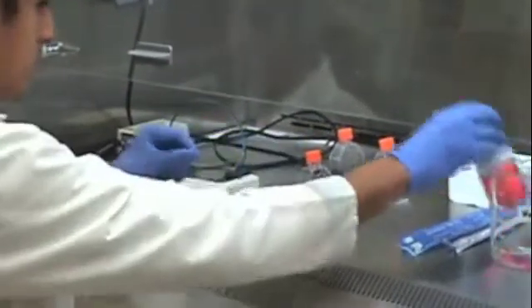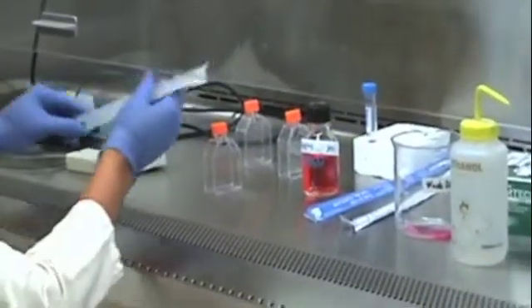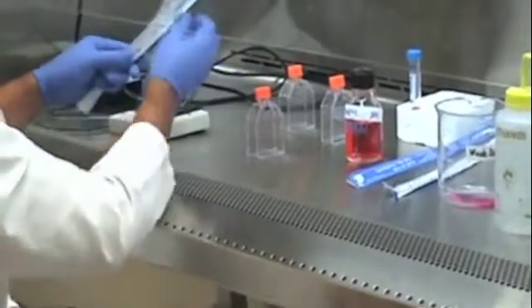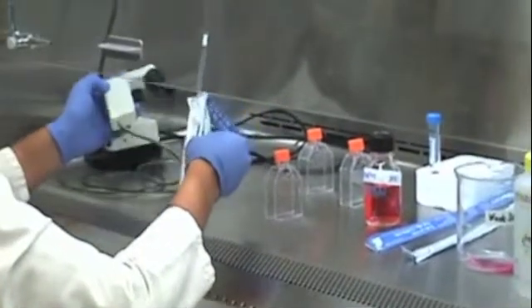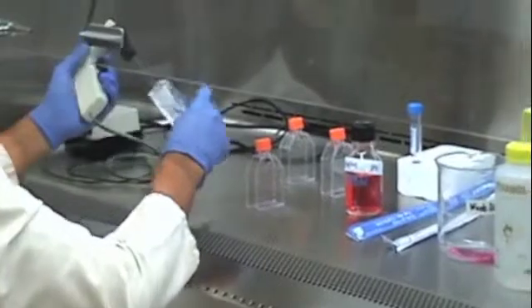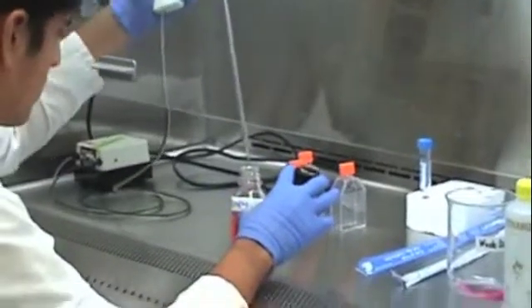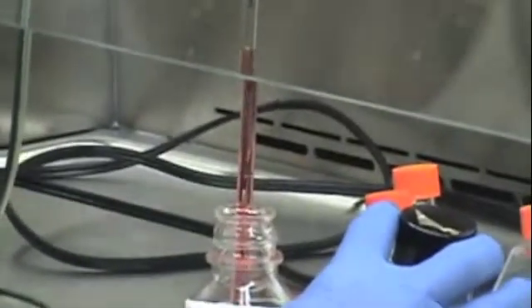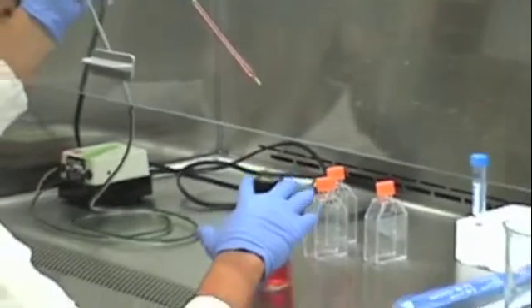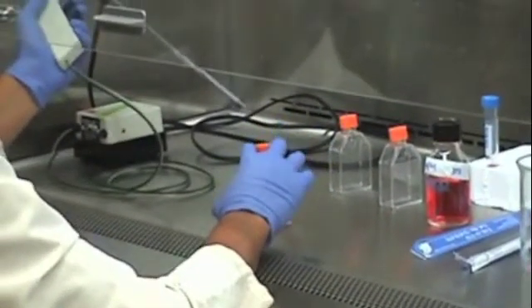After checking in the microscope that our cells are actually in suspension, Carlos is going to add 3.5 mL of DMEM because we're using 3T3 cells. This will deactivate the residual trypsin that is in the flask. Before passaging our cells to a new flask, we want to do a cell count.